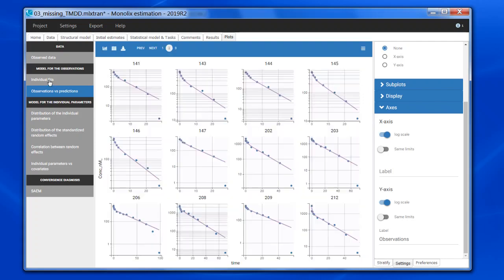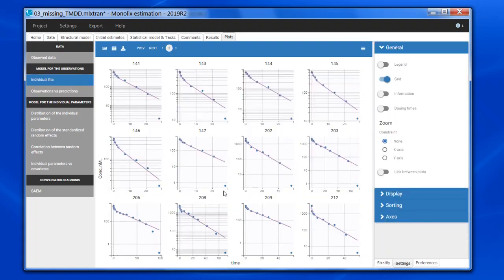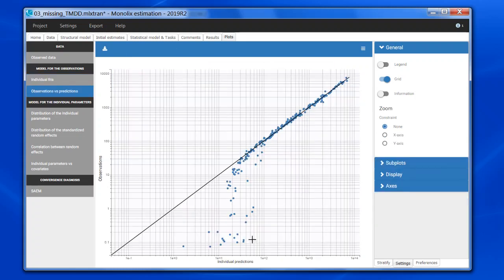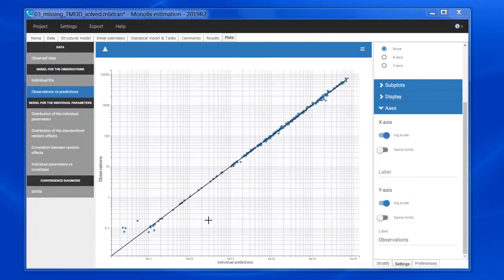If I look at the individual fits, in this example, I can see the model misspecification also here. But sometimes the individual fits are less clear, and detecting this pattern in the Obs vs. Pred is really a real help. If, on this dataset, I instead use a TMDD model from the library, then the Obs vs. Pred looks like this, without any deviation anymore.